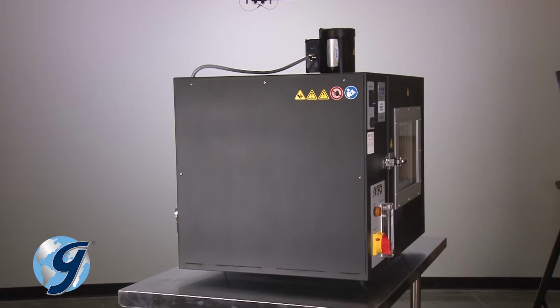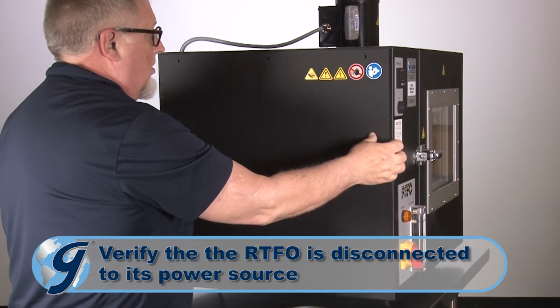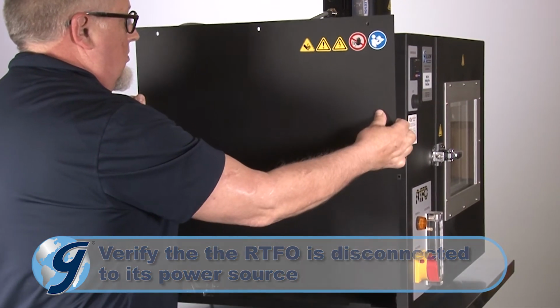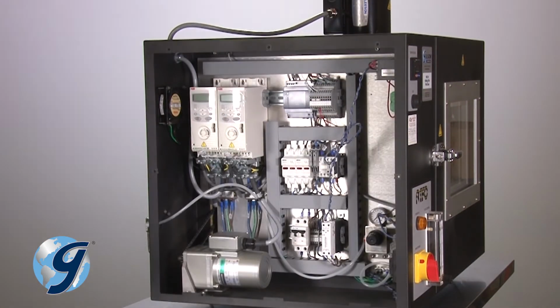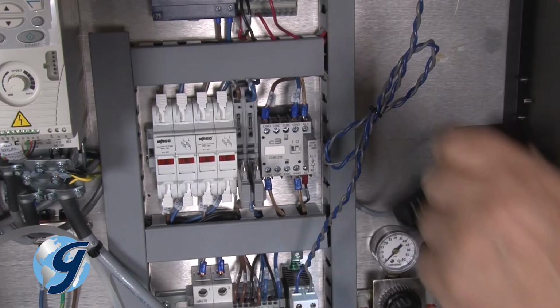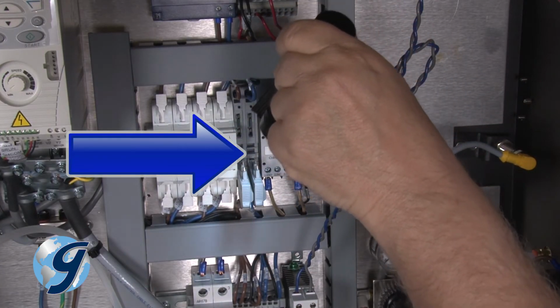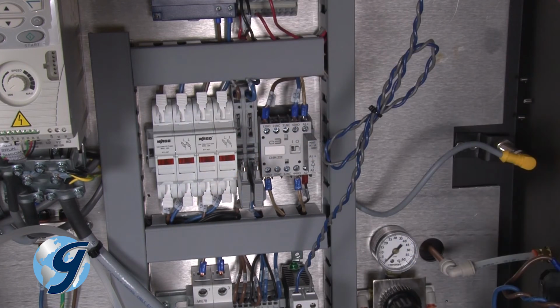To check the power supply, you need to remove the side panel. Verify that the RTFO is disconnected from its power source before removing the side panel. Now we have access to the internal components of the unit. Now verify the 24-volt DC power supply fuses are not blown, and replace as necessary.